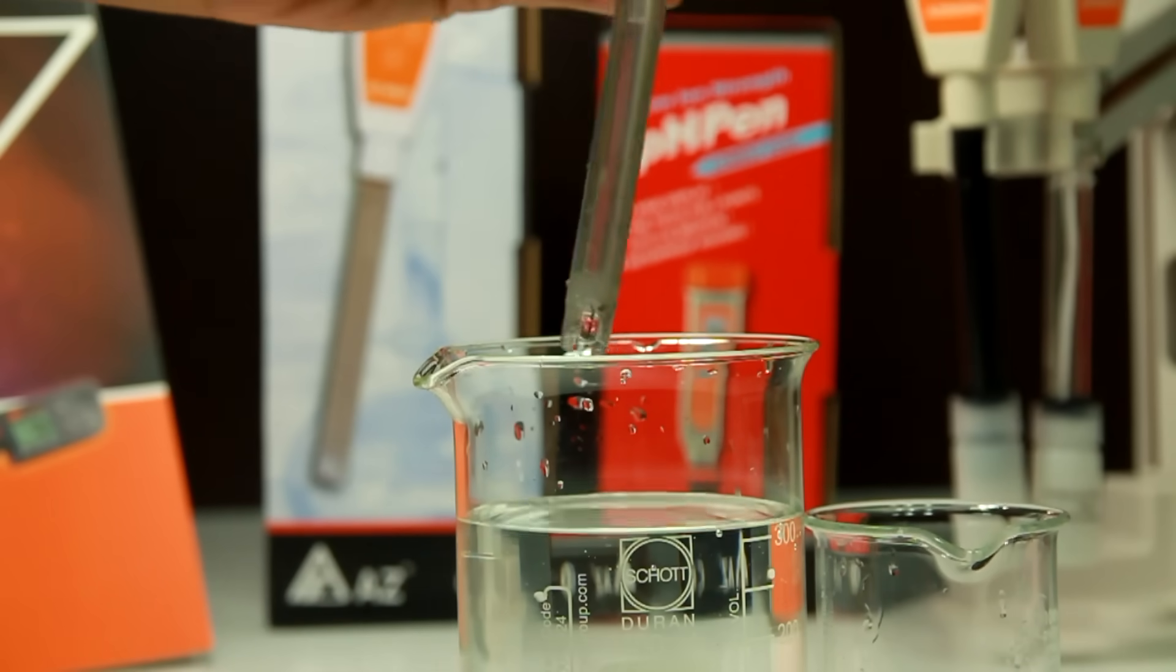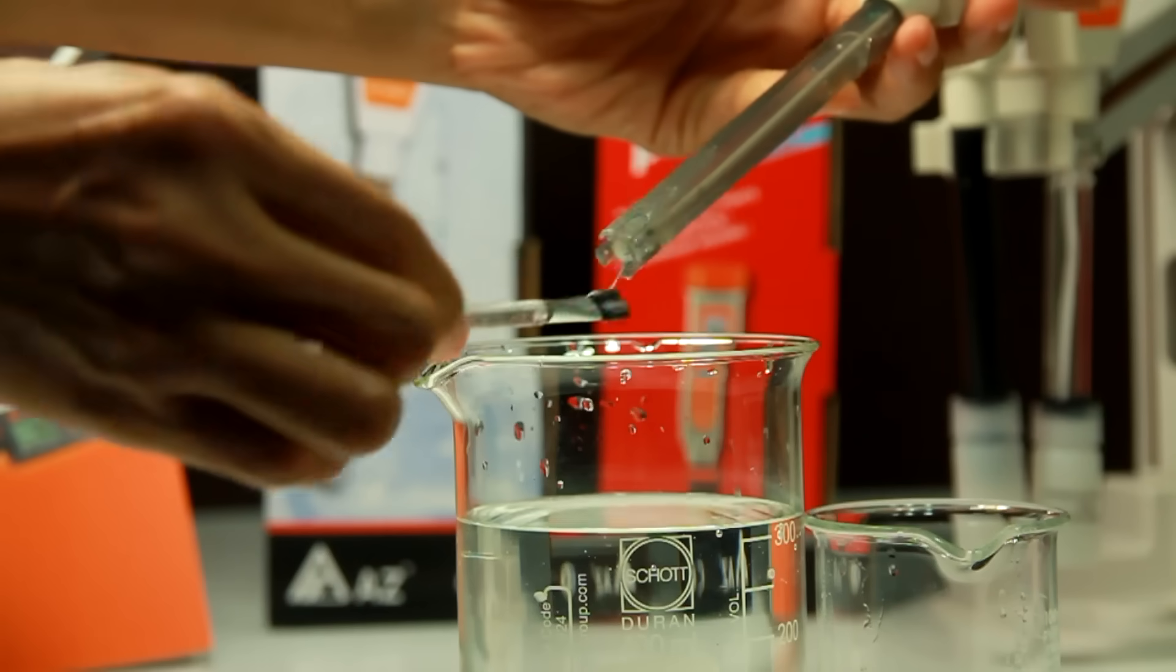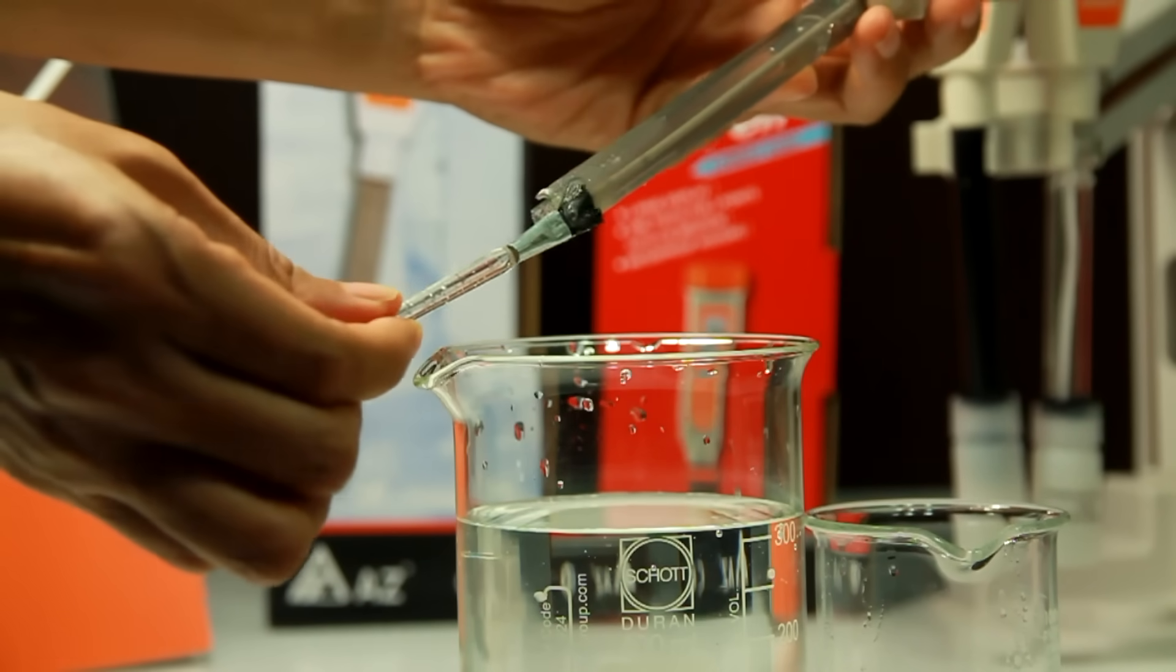If the probe is very dirty, you can use soft brush and neutral detergent to brush very softly.